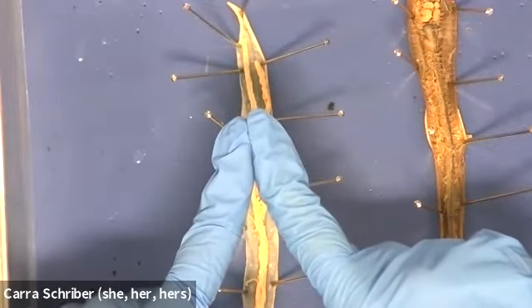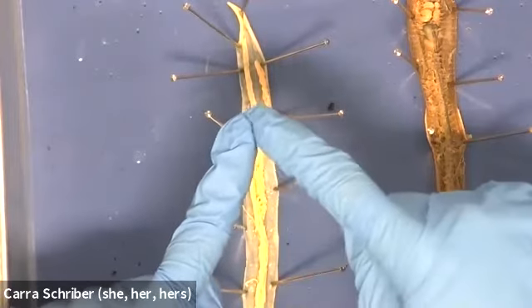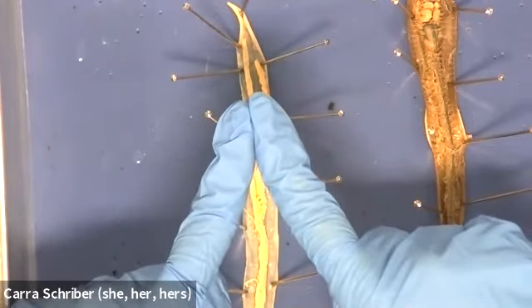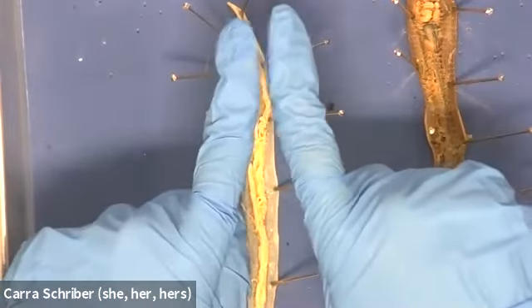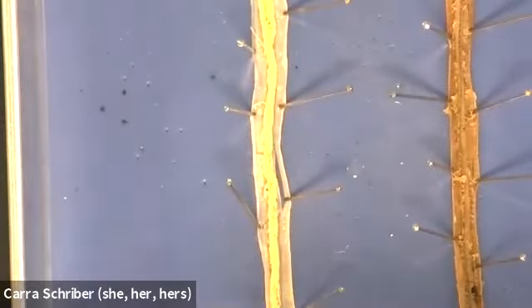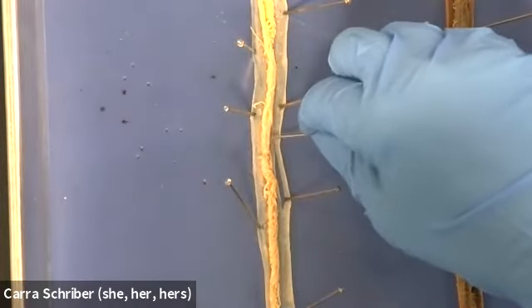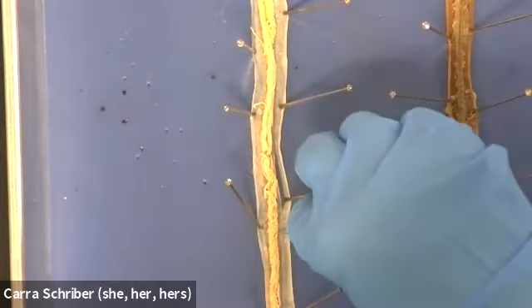This is actually the two tubes of the uterus, and the vagina would be here at the tip where these two parts come together, like where my fingertips are together. And then the uterus are the tubes that come off on either side. These two tubes are going to progress down the length of this until about halfway down to 2/3 of the way down. And then they come back together.